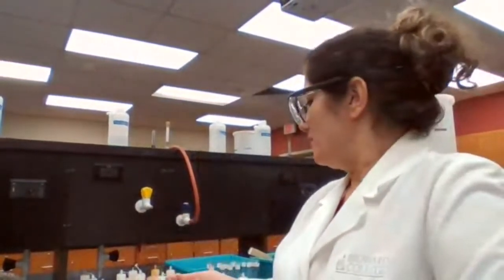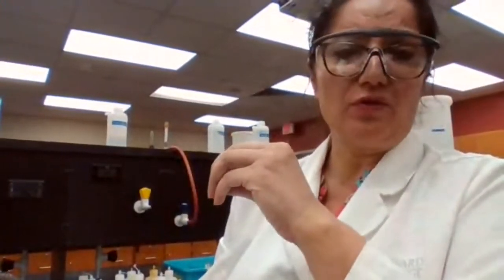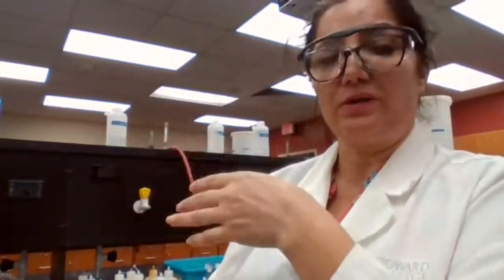Let's say for the first table, when you mix test tube 1, you mix barium chloride and sodium sulfate. Barium sulfate forms a solid and is going to stay as BaSO4, and you don't separate it. It doesn't change to ions. But the second compound, sodium chloride, changes to sodium ion and chloride ion.